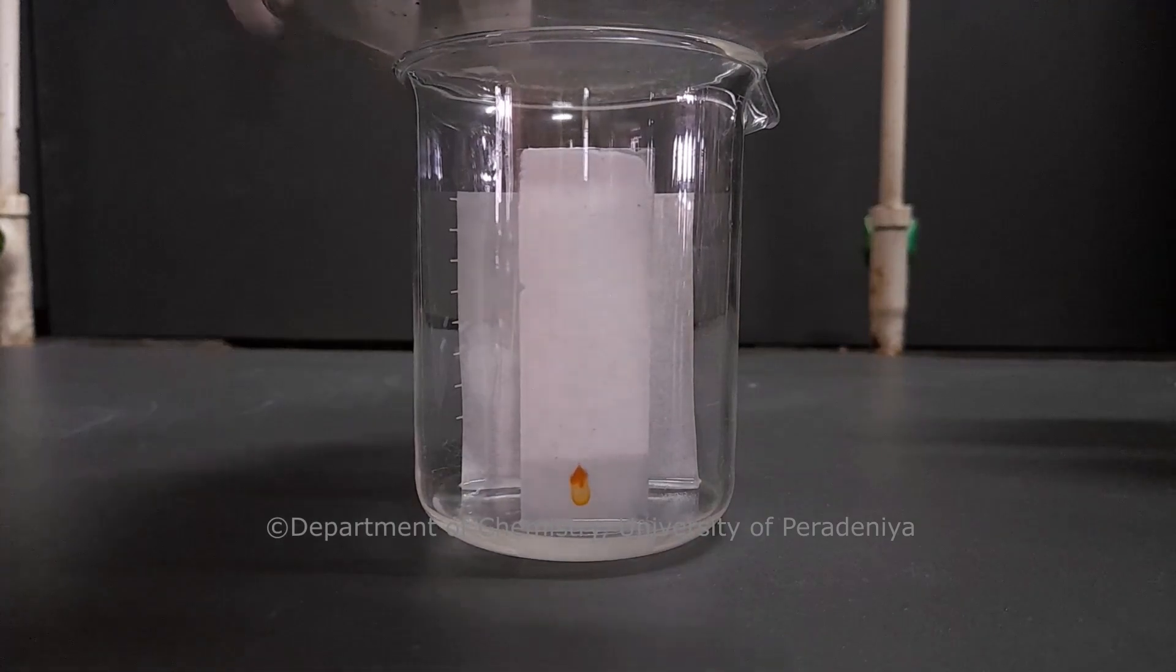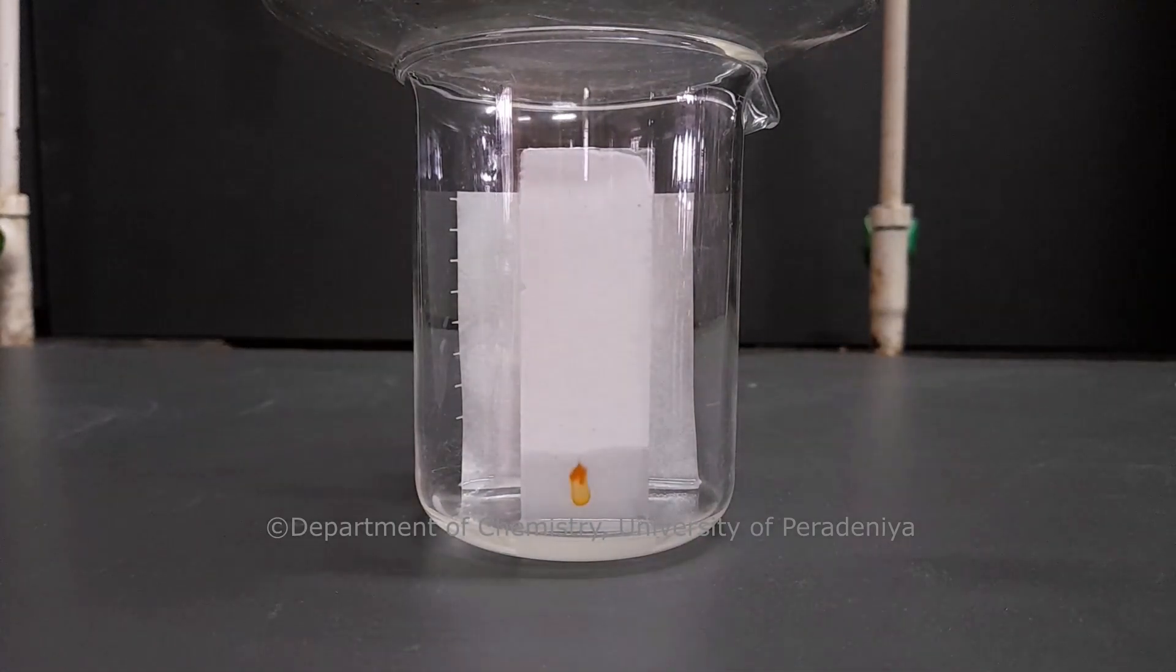Then the chamber is closed and kept without any disturbance. Keep a close eye on the solvent front, which is the wet moving edge of the solvent. It can be observed that the solvent will carry the compounds along the plate in upward direction.